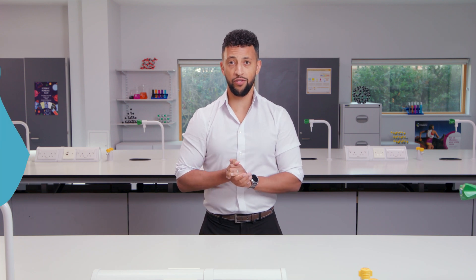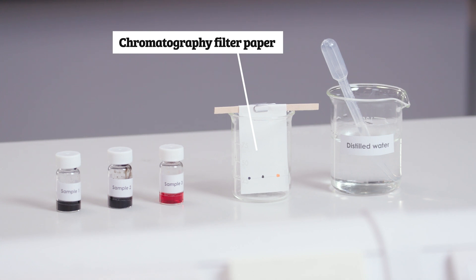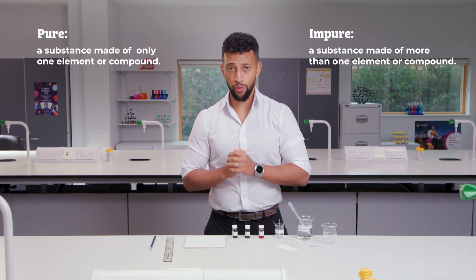We're going to use paper chromatography to see what colours are in different inks. I'm going to use chromatography filter paper and three inks to see if they are pure or impure.